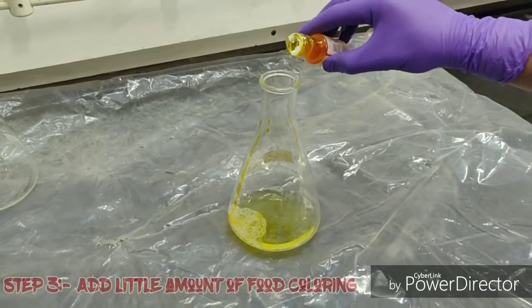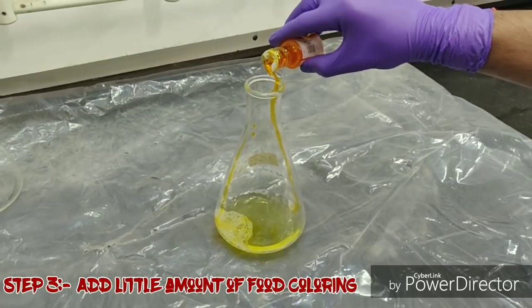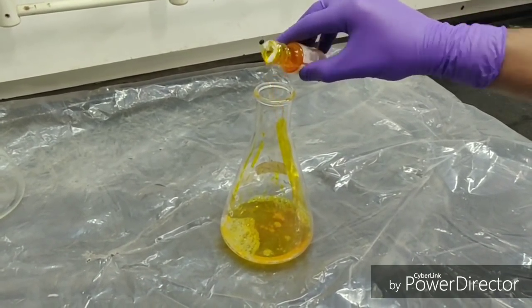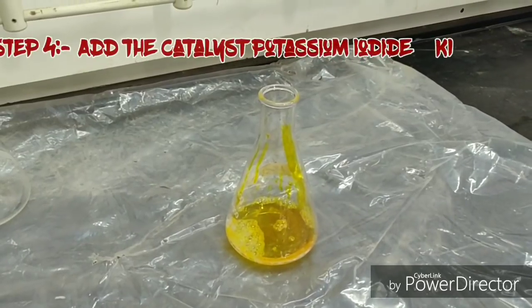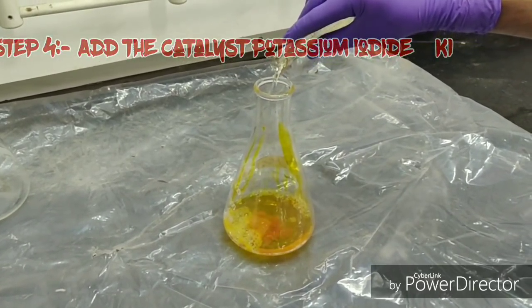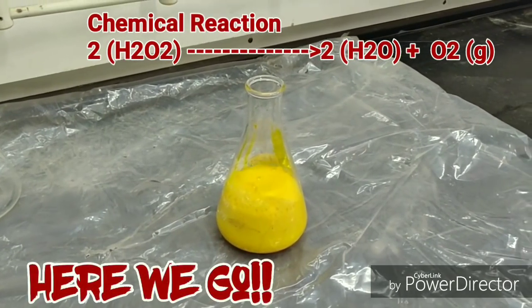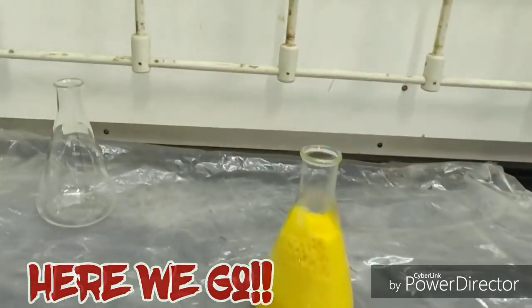Now comes the important part as we are going to add our catalyst, potassium iodide. Now let's see what happens — here we go.